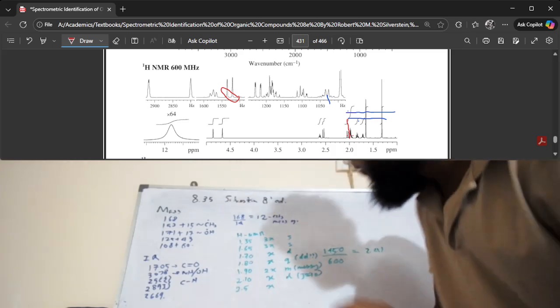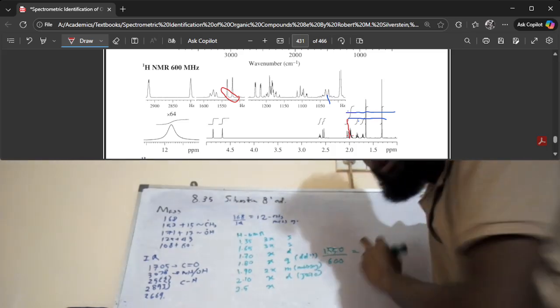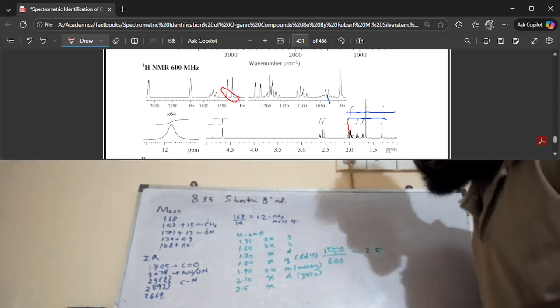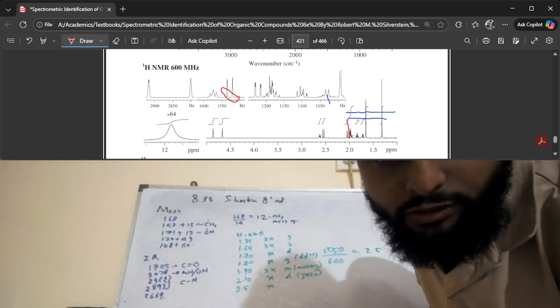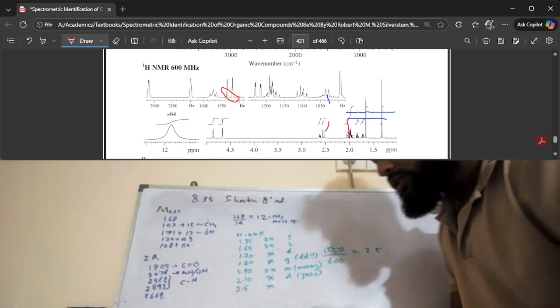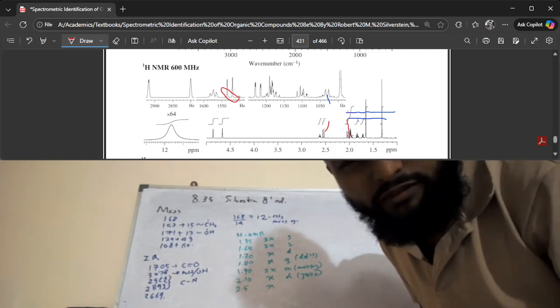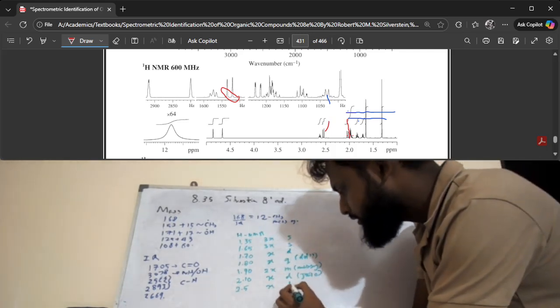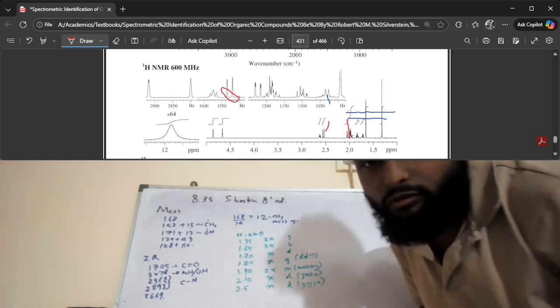Sorry, that's 1500 something, no? 1500 something. So that's about 2.5. So we know that the peak I have circled corresponds to this peak, right? So we are going to mark that as a doublet because it's a very clean and neat doublet, and you can see that the J coupling is about 10, right?